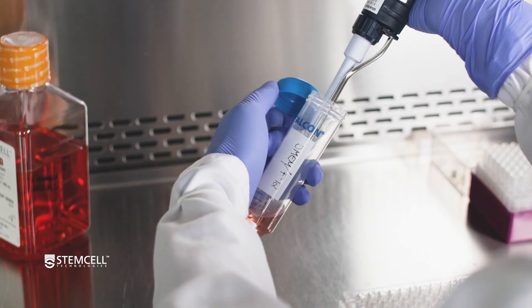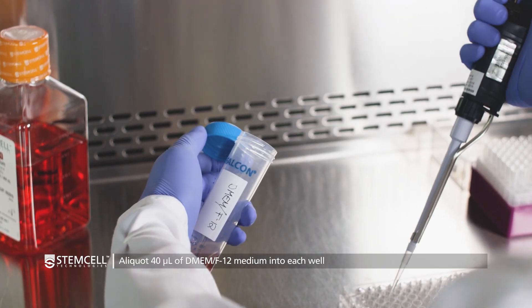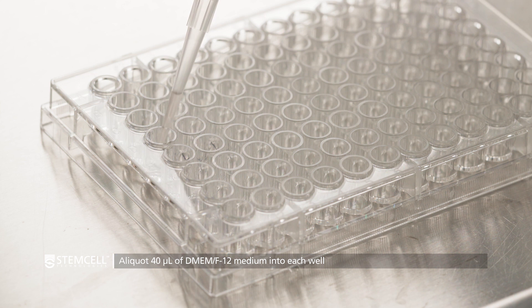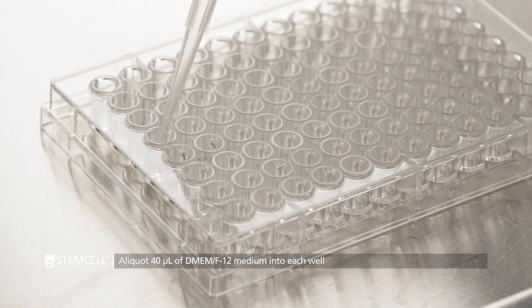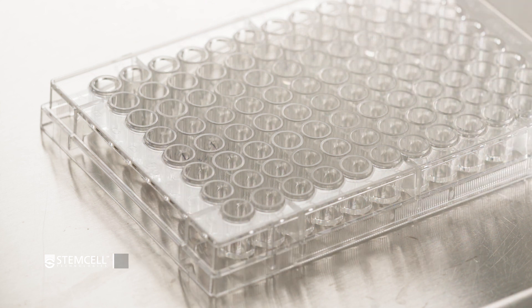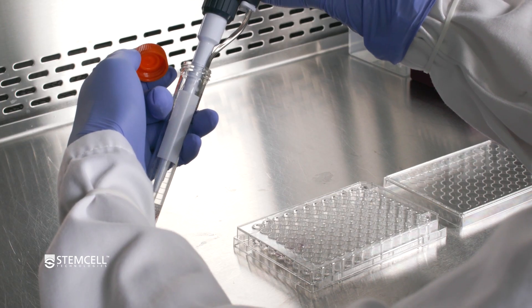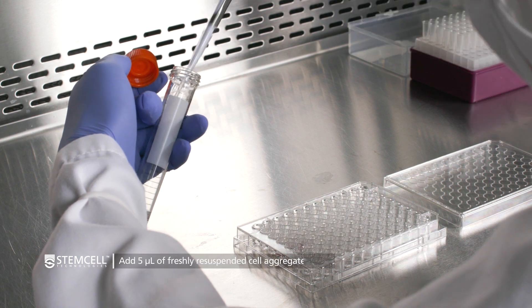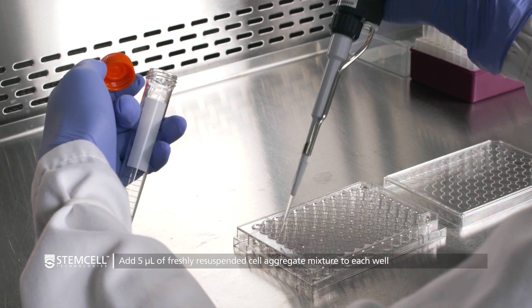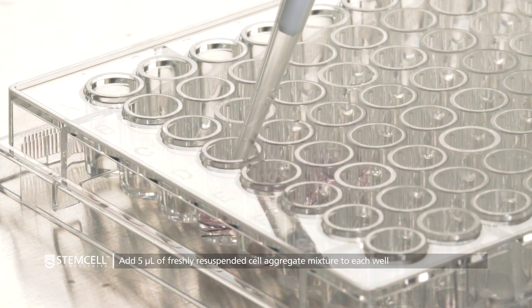Pipette 40 microliters of DMEM F12 medium into each well. Next, add 5 microliters of freshly resuspended cell aggregate mixture to each well.